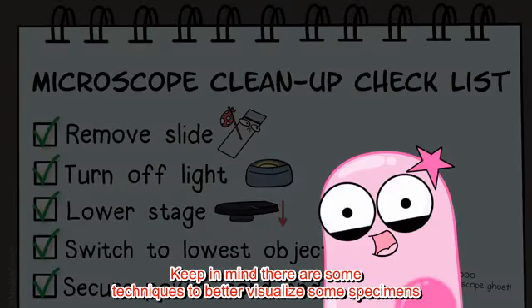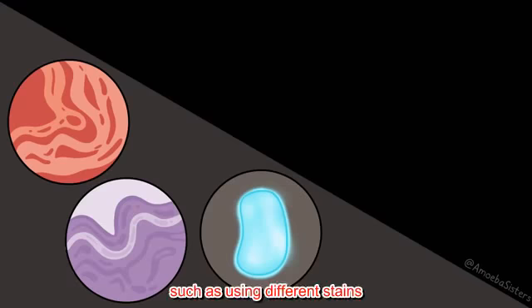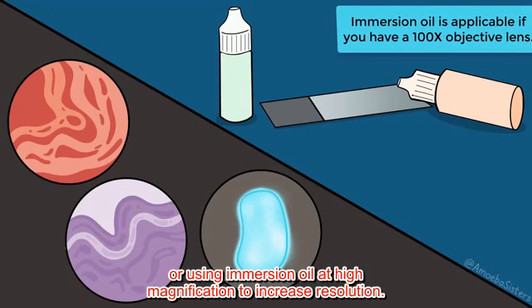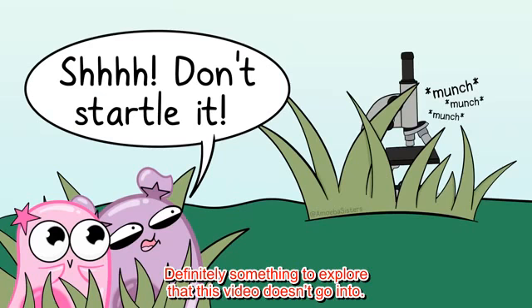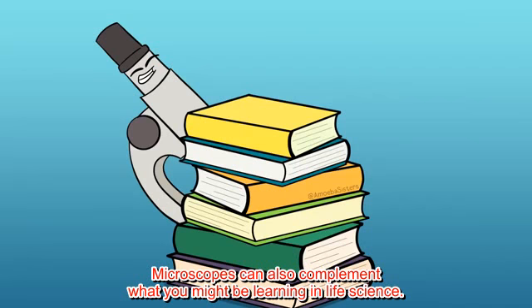Keep in mind there are some techniques to better visualize some specimens, such as using different stains or using immersion oil at highest magnification to increase resolution. Definitely something to explore that this video doesn't go into. Microscopes open up an entire world that you can't see with the naked eye. Microscopes can also complement what you might be learning in life science.